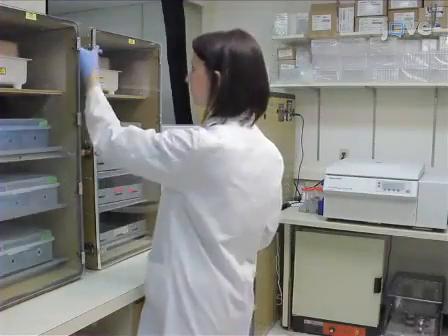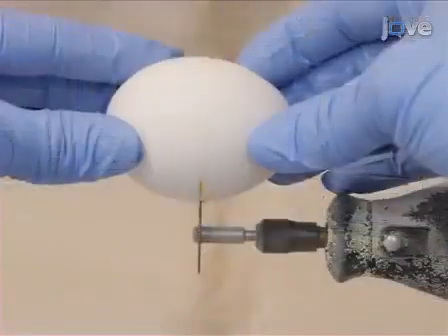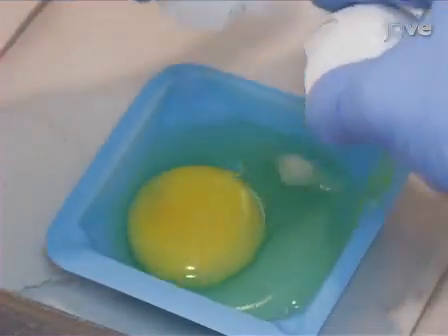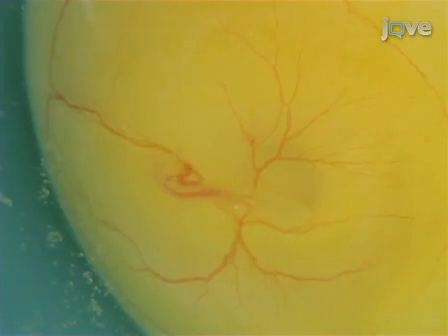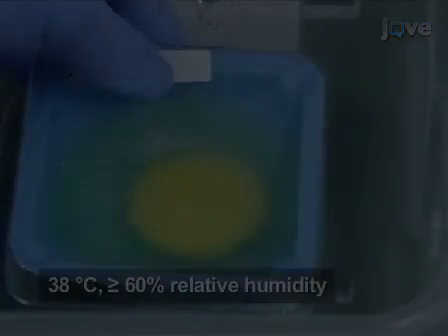For this protocol, prepare shellless fertilized chicken embryos at day 4 using the standard method. Ensure that the embryos are fertilized and viable by checking for a heartbeat, and incubate them at 38 degrees Celsius.